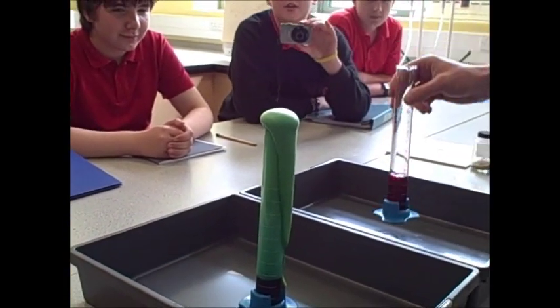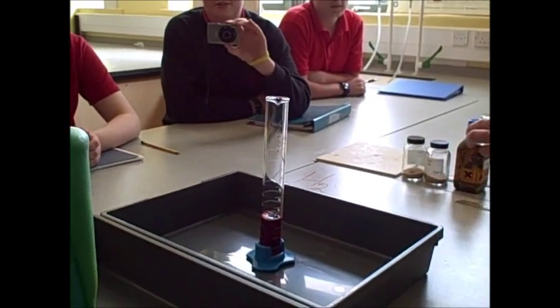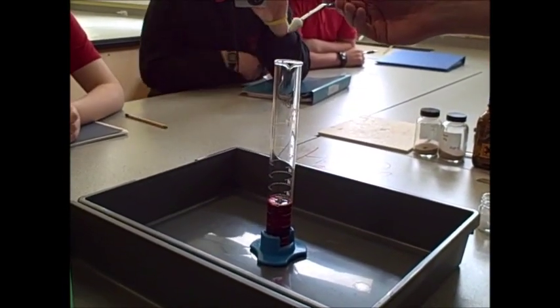Let's take this hydrogen peroxide, which has got a subtle difference — I haven't told you what the difference is yet. We put red food colouring in it for no other reason other than to make it look nice and a bit different. So, potassium iodide again, and we'll bung it in.